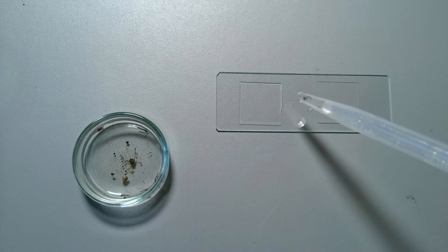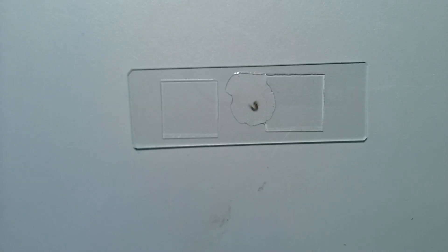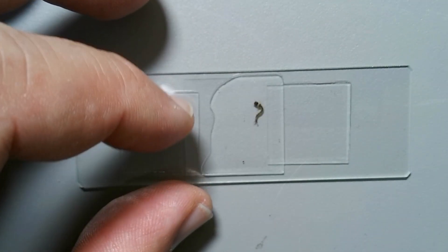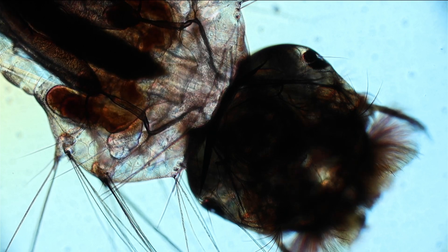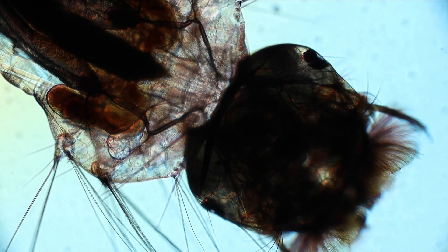Those larvae are fairly large, so this means I used some spacers. You can see that I placed left and right of the mosquito larvae a cover glass, and I put a third larger cover glass on top over it. So the mosquito larva was limited in its movement, but it was not completely crushed. Under the microscope, this is how it looks like. I have to tell you, I do consider it, to a certain extent, beautiful. Beauty is not only in symmetry and aesthetic appeal, but also the intricacy of nature and all of the details.